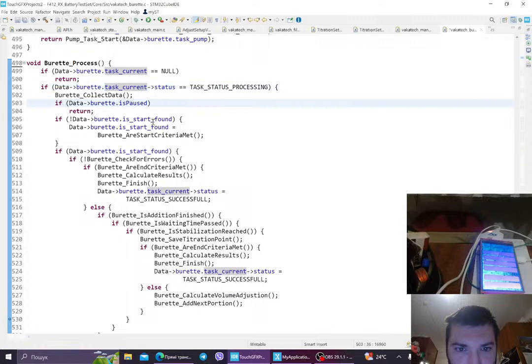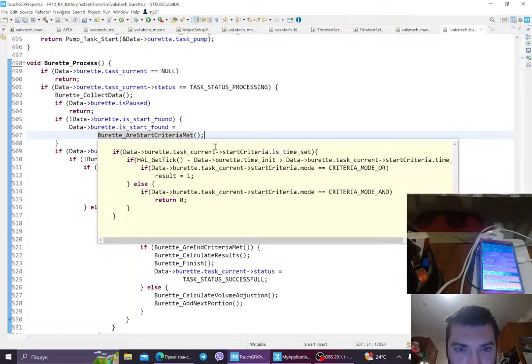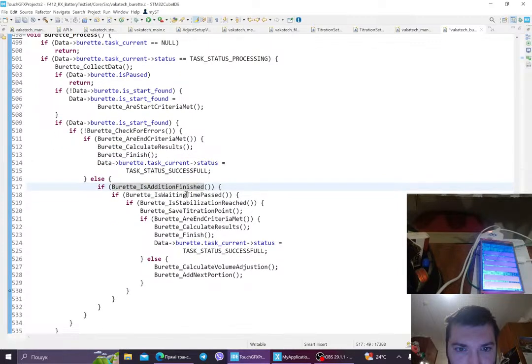This loop goes like this. So first of all, we collect the data, and if we have not yet started, we have to see if it is okay to start. Yeah, so burette start criteria met. And here we see if they are met. We look at each start criterion that is set up, and if they are met, then we can proceed. And on the next loop it will already be true, it will already be 1, so we won't check it again. Once it's started, we're gonna check for errors, we're gonna see if the criteria are met, and we're gonna calculate the results if they are met. If they are not, then we're gonna check if the addition is finished, if the waiting time passed, and so on and so on.